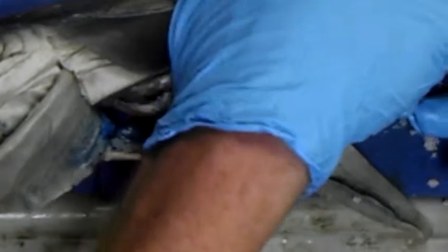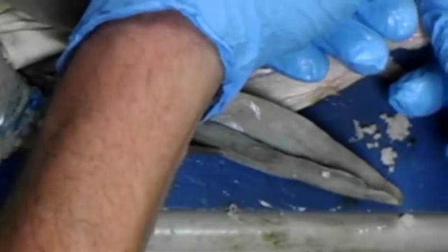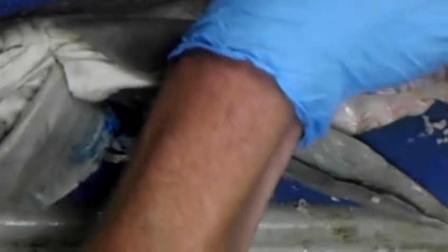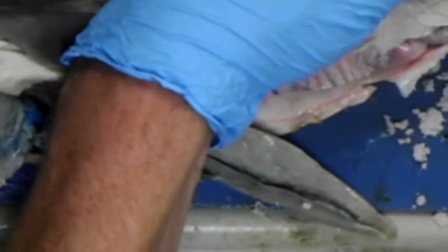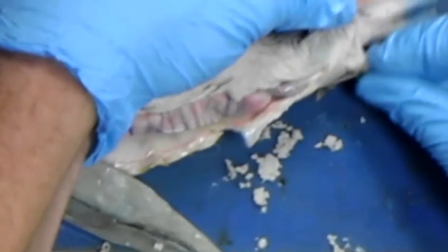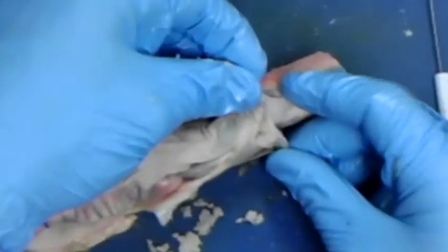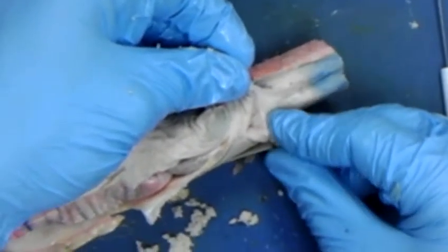Then you're into the small intestine, and trust me when I say after this you've got a rectum and then an anus. Okay, it's in there. And then the anus comes out in a common opening called a cloaca. And cloaca has evolved independently multiple times in the animal group. So reptiles will have a cloaca, but it's very different from this cloaca.